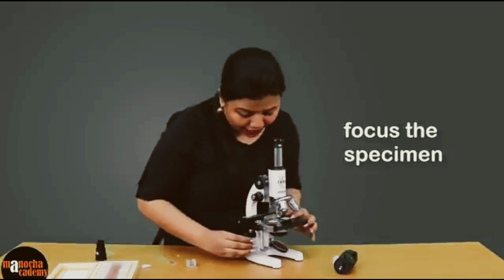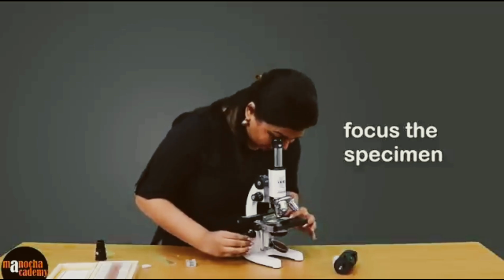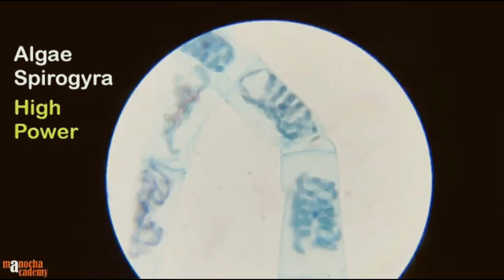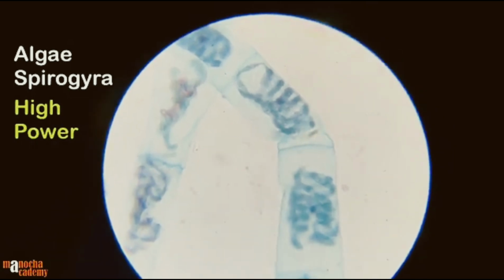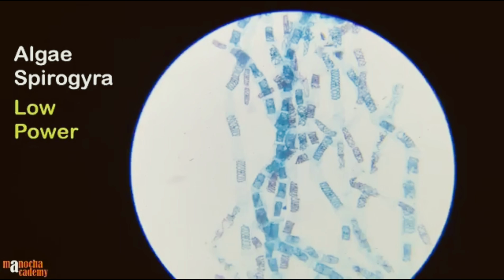And while you are doing that, you can move your slide right or left so that you can bring the specimen right beneath the objective lens. And now I can see a very distinct view of the algae Spirogyra under my microscope. So this is how the specimen looks under the microscope in high power and in low power.